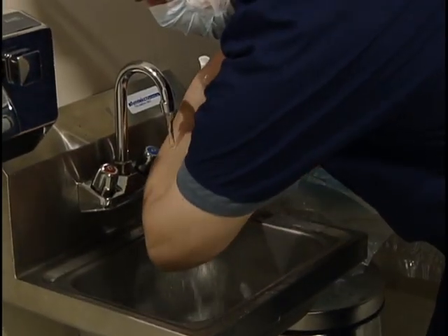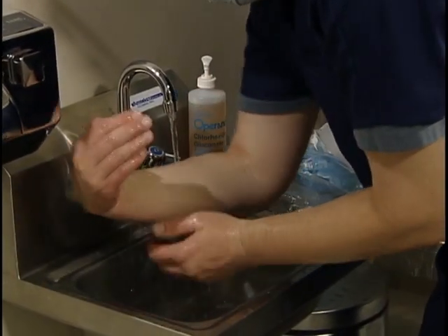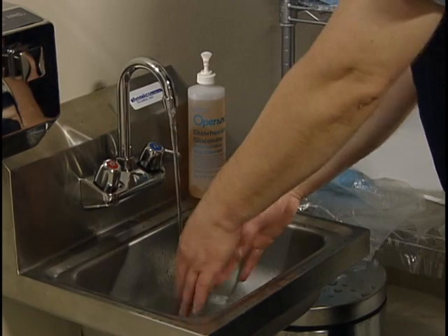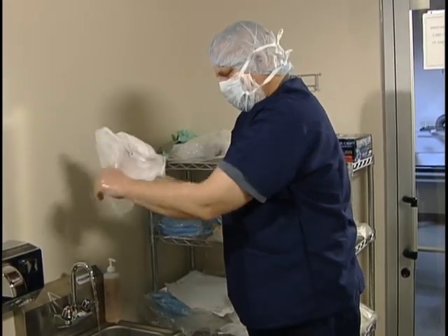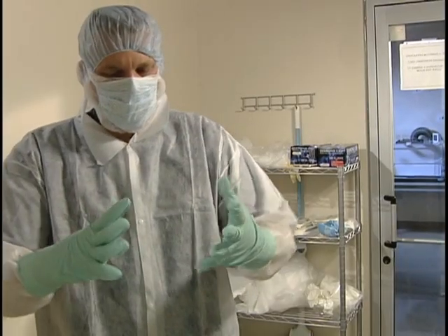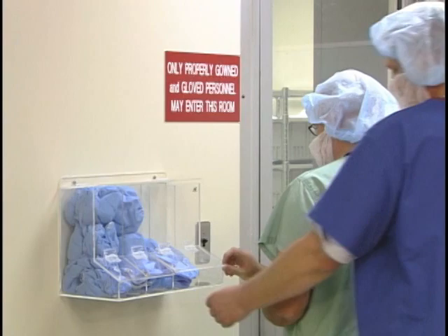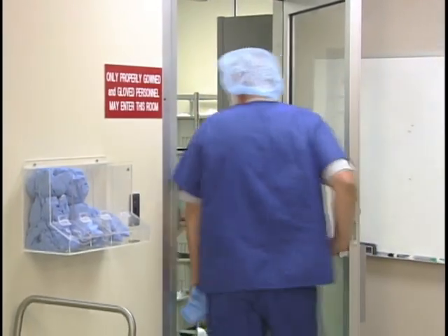After scrubbing, rinse well, holding your hands upward towards the water so the dirty water and soap runs toward the elbows and not the hands. Hold your fingernails under running water to make sure they are properly rinsed. To finish, use a clean, lint-free towel to dry your hands and use a towel to turn off the water. Now that your hands are cleaned, don't touch anything except for garbing supplies. To avoid recontamination, do not leave and re-enter the compounding area without performing proper garbing and hand washing techniques.